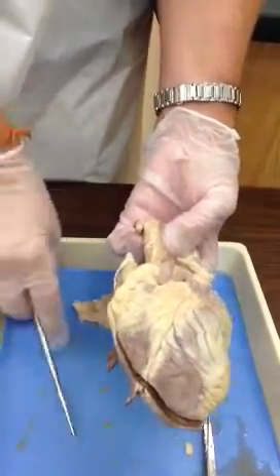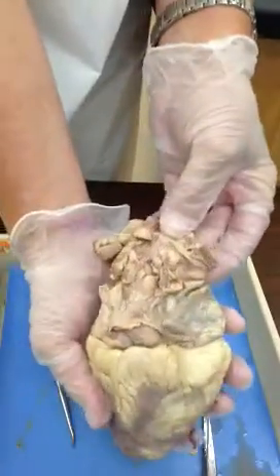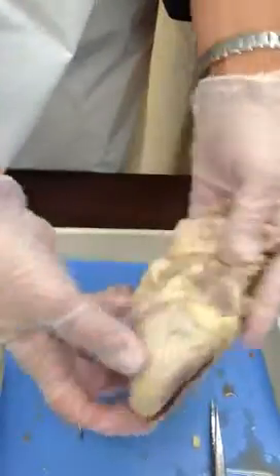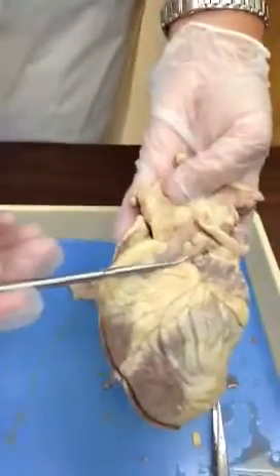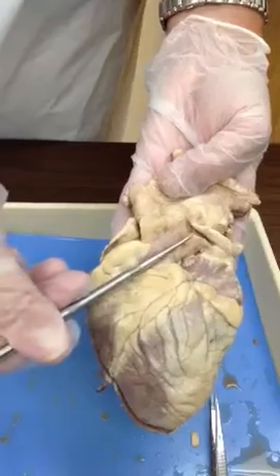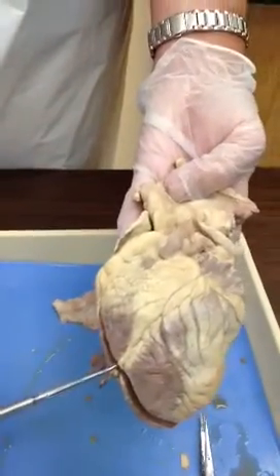We know we are on the anterior. The posterior will look a lot messier. You'll have vessels coming in all different directions. So I find a dissection specimen that's nice and clear and smooth. Then I will be able to see a large vessel coming off this right ventricle.